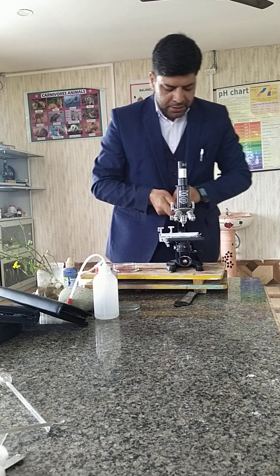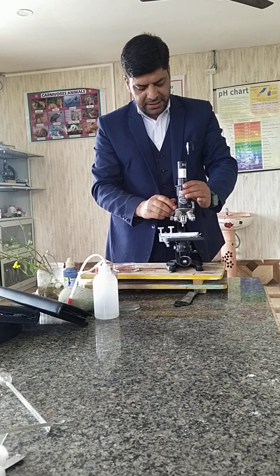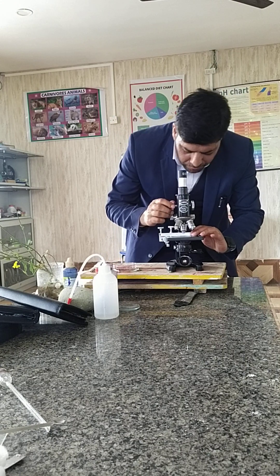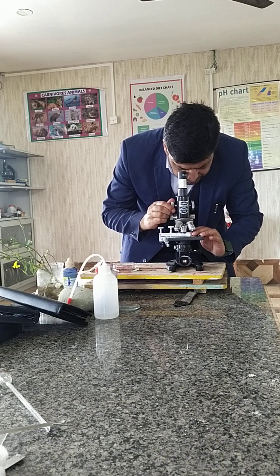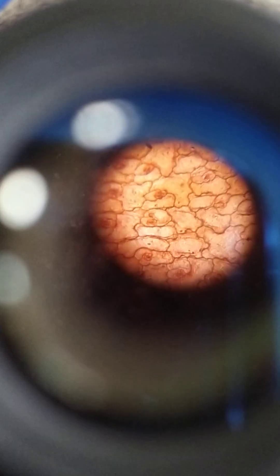This is a very simple but very interesting activity, suitable from class 5 to 12. The sample is ready, and now I will adjust the light and focus the microscope. As I am focusing on the stomata it takes a moment — and here it is! You can now observe the clear structures.